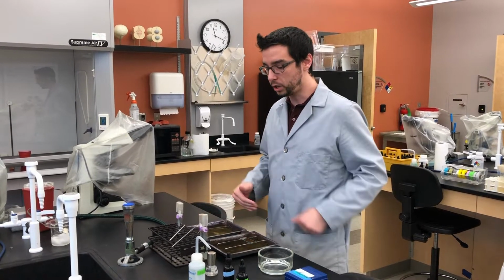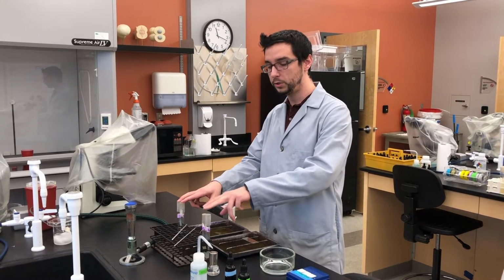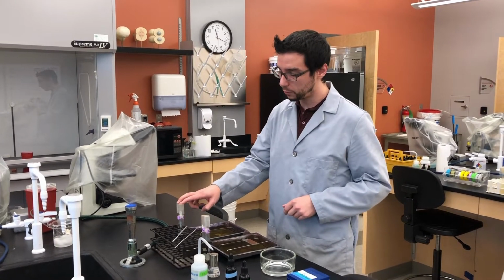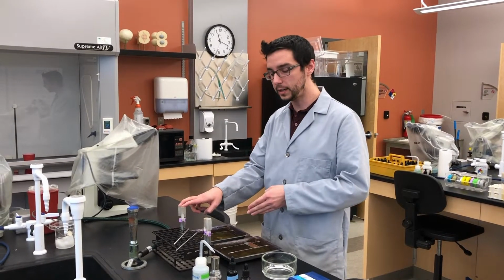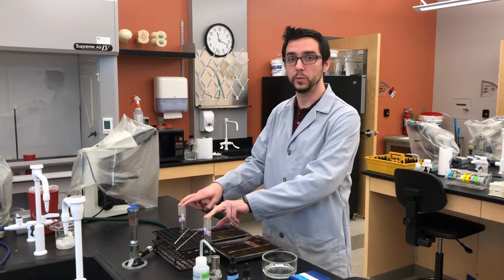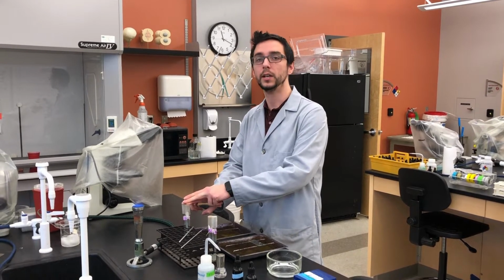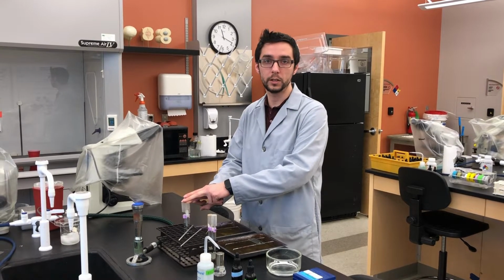Now, what you're going to notice when you come into lab is that you have two different sets of tubes available. You have two different bacterial species that have been cultured for 1 day on a slant, and those same two different bacterial species cultured for 4 days on a slant. The reason for that is 1 day on a slant is not enough time for an endospore forming species to form endospores. However, on a 4-day culture on a slant, an endospore forming species of bacteria should start forming endospores.